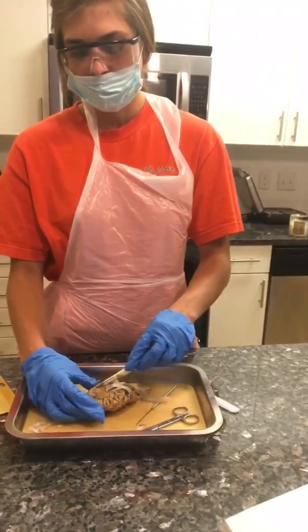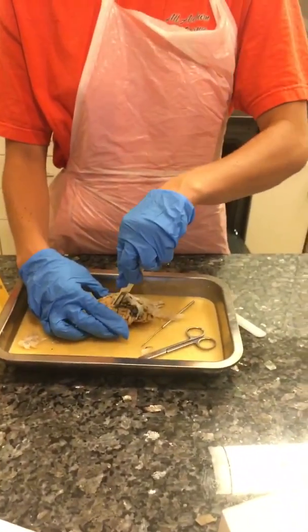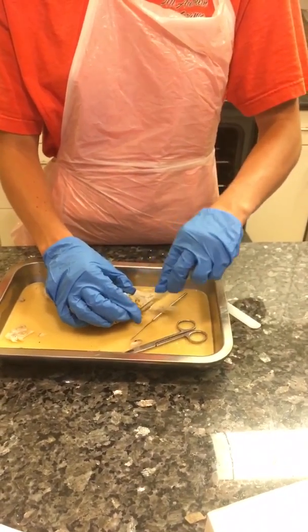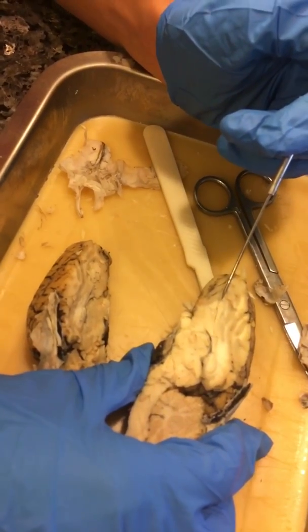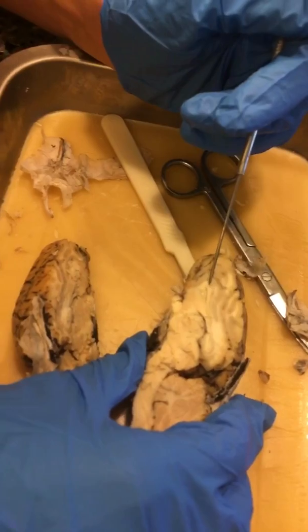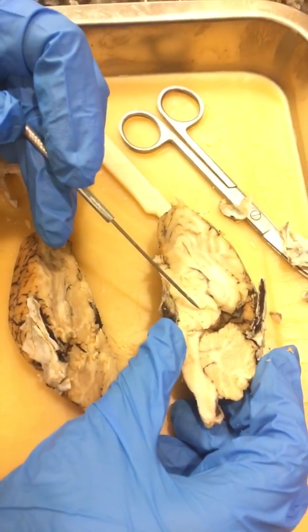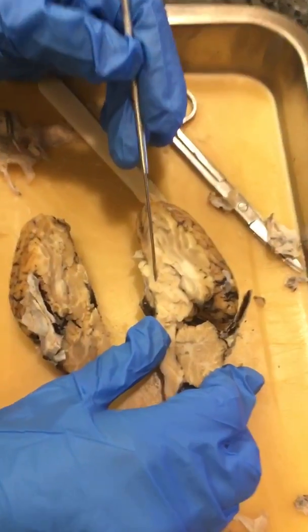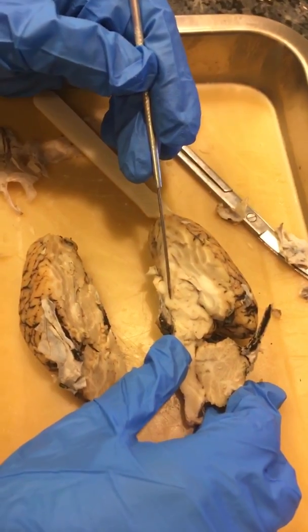Now we're going to cut down the midsagittal of the brain and open it up. In the midsagittal section, we see the corpus callosum. And here on the sheep brain, we see the thalamus.